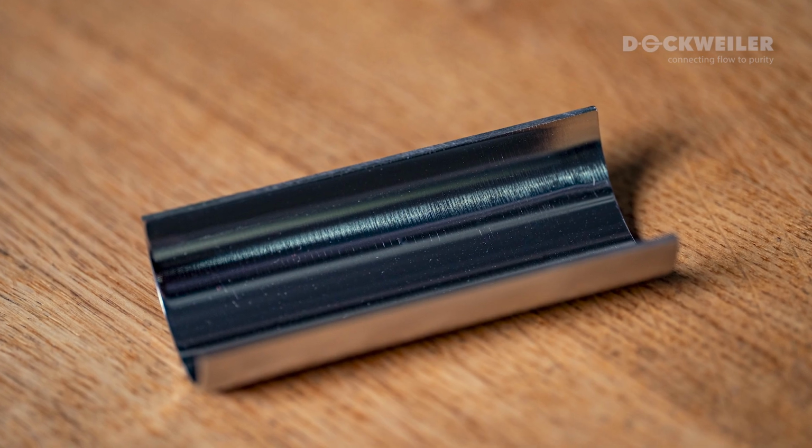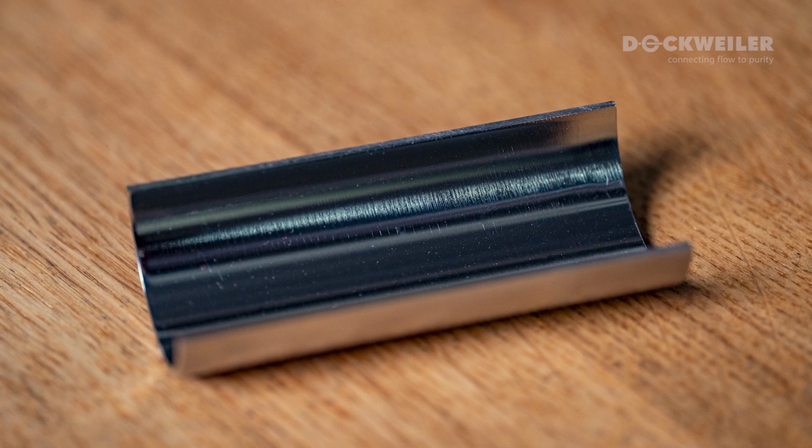You need to know that a standard pickling process goes just 3 to maybe 5 micrometers, maybe even a bit less, into the material. So let's assume 3, and there we develop this more and more. It's certainly going down further than 3 micrometers into the material. We can also apply a slight electropolishing process to go a bit deeper, roughly 5 micrometers into the surface. The 5 micrometer specimen is what I have in hand here, and it looks already kind of bright and shiny, but still there's a difference between a full electropolished material and a specimen like this.